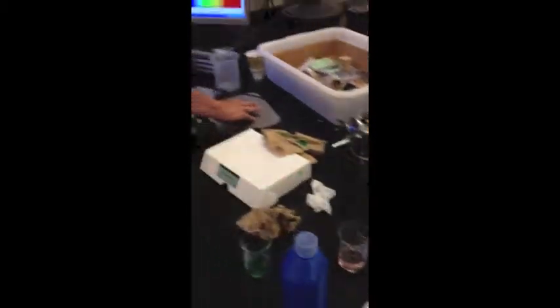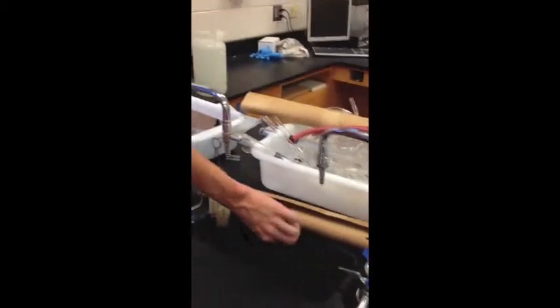So, now we've done one solution, we will do one more. So, click stop. And same thing, rinse out the cuvette. This is a kind of rose-colored solution. Kind of ran out of red food coloring. Sorry. So, I wouldn't listen to Radu. He usually messes everything up. This is take 2.